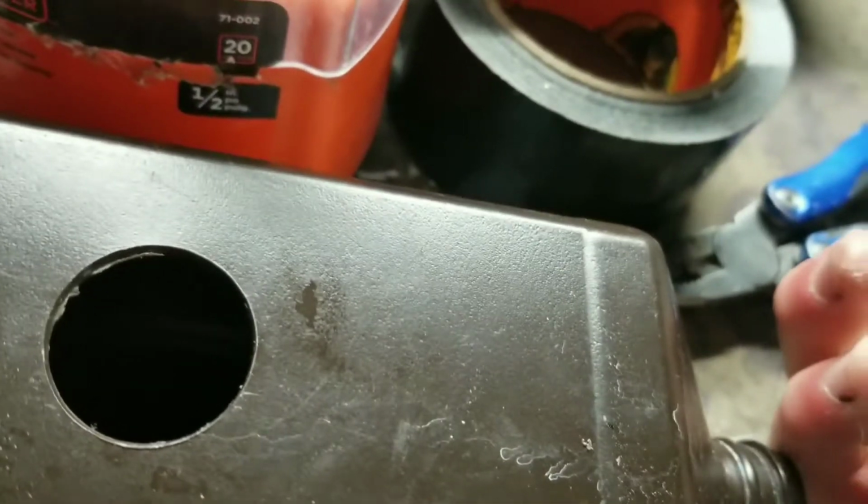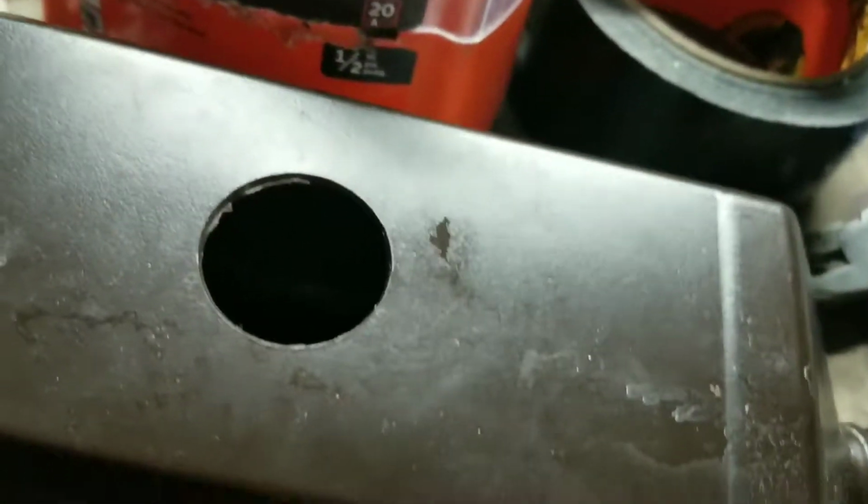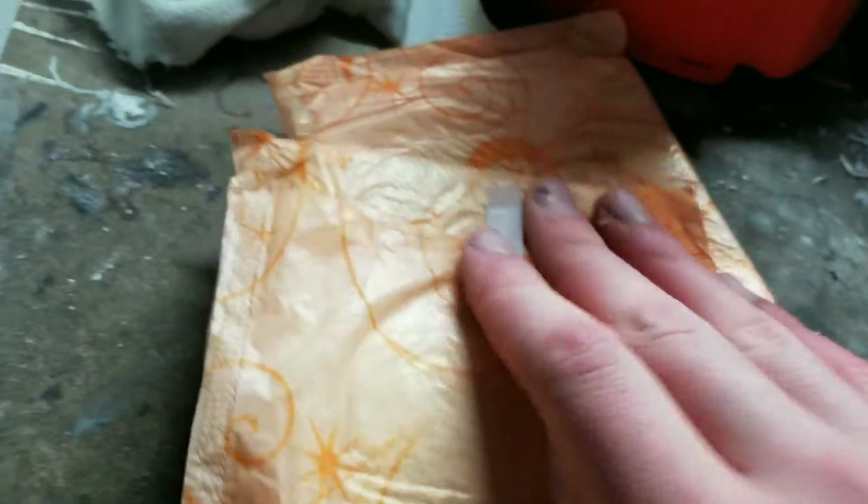Now I have drilled this out, and before I completely attach it to this thing, I'm gonna need to do a little modification. Okay, now this is a little bit awkward. Now you see, I don't really have sodium polyacrylate, but I know that it's in diapers and also these things. So, yeah, I'm gonna need to tear this apart to build my membrane cell electrolysis rig.